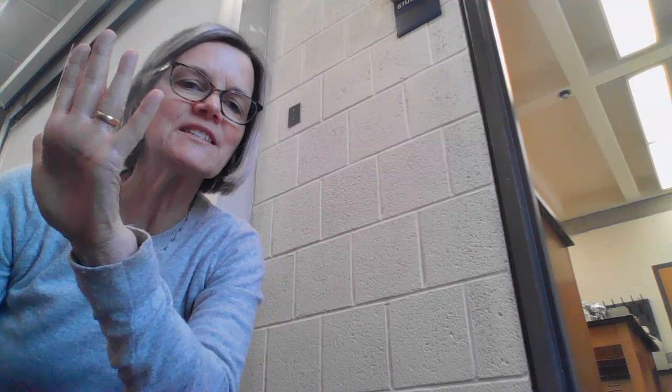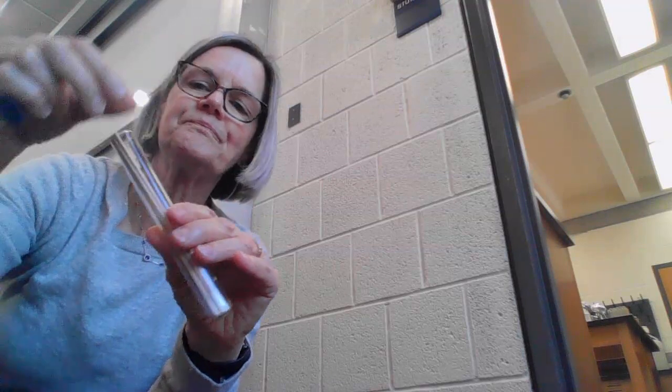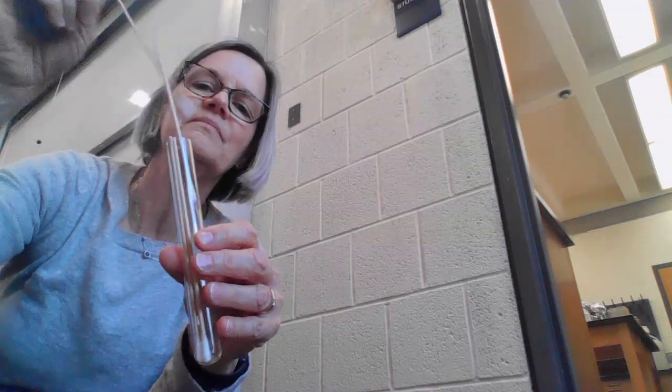In the second part of this experiment, I'm going to use my trusty assistant to give me some more samples. The question I was wondering is, will the bottom of my dog's foot have microorganisms that are more similar to those on my skin, those in dust, or those found on the bottom of my shoe? And so I'm going to do the same thing. I'm going to take a sterile swab. Oh, there we go. And some water.